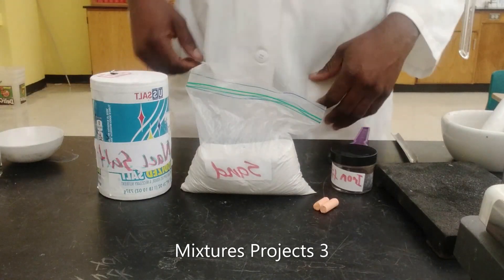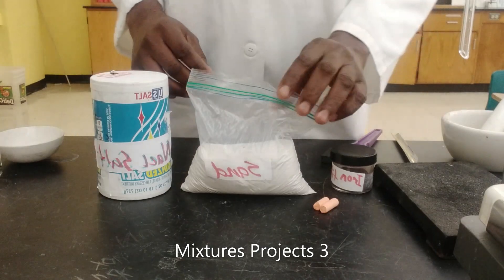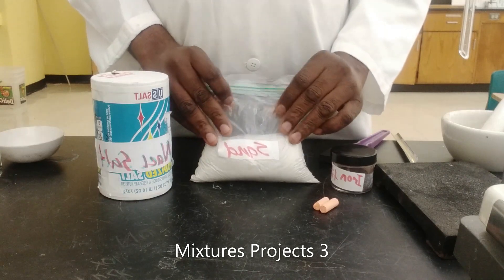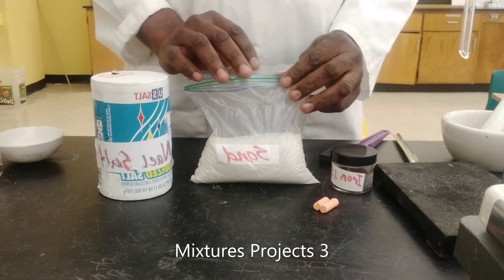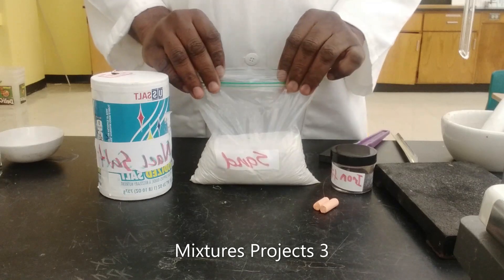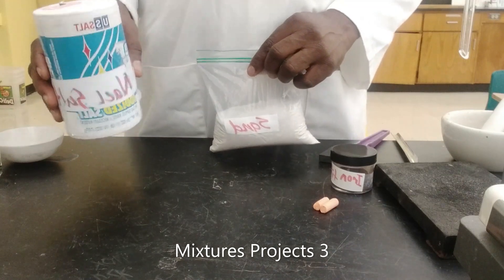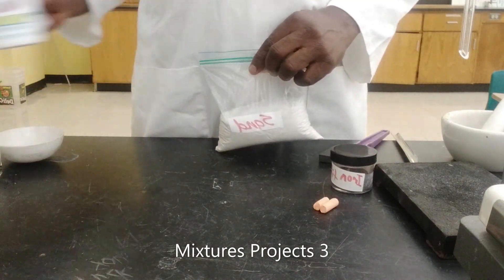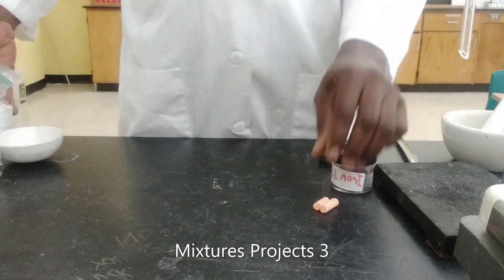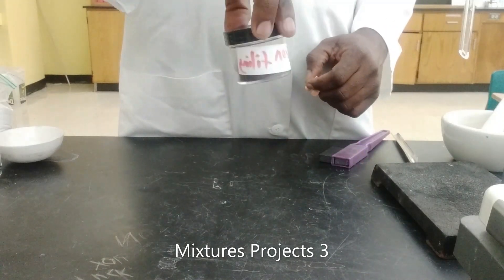Hello and welcome to another edition of LabSci Project. In today's video we will be conducting a little experiment to separate mixtures. We will be separating a mixture of salt, sand, chalk, and iron filings.